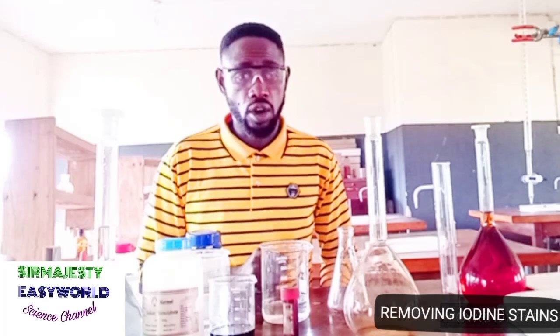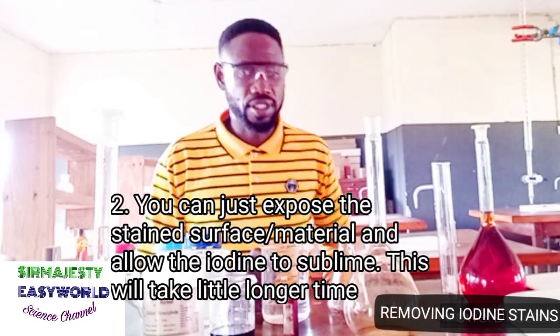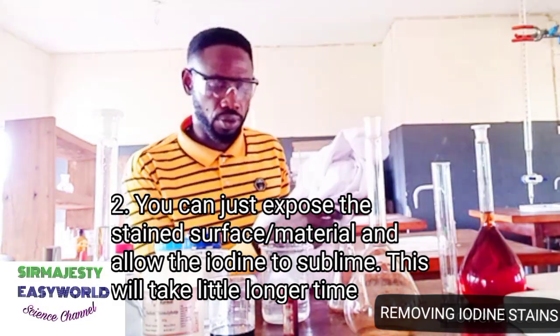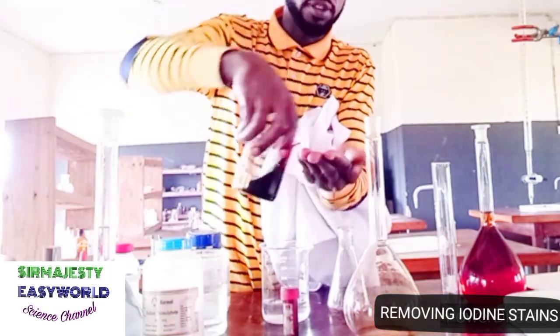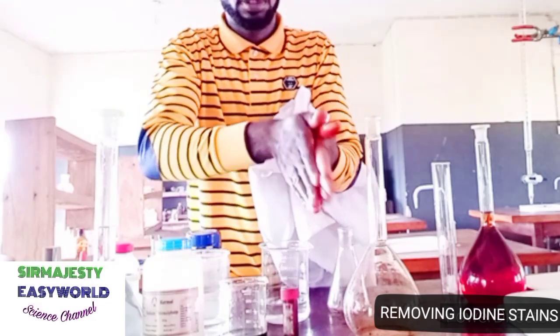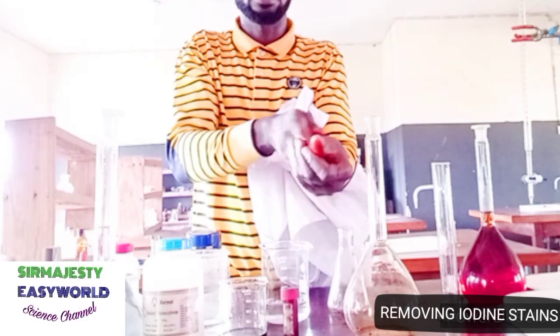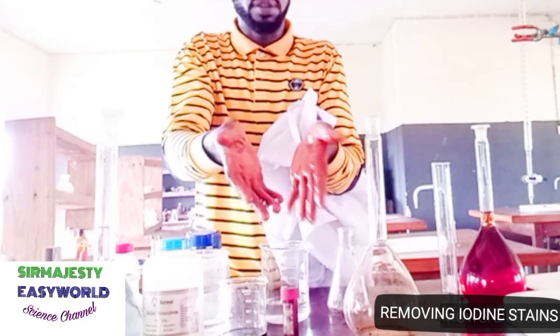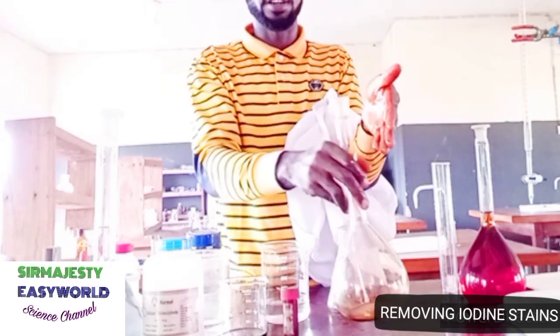Or you can use the second method, which is to be patient. Remember, iodine is volatile and sublimes. So if it stains anywhere, even your hand, as you can see, it's not a funny thing. You see my hand, it cannot just go like that. If you wash and wash and wash, the stain will still remain there. If you wash with water, you can still see the iodine remain.